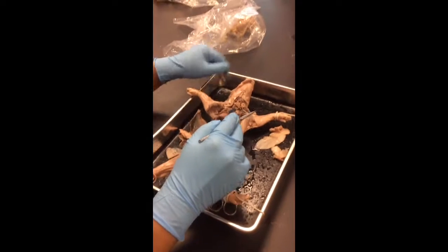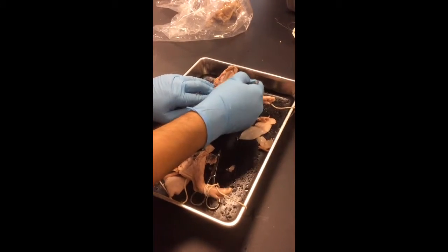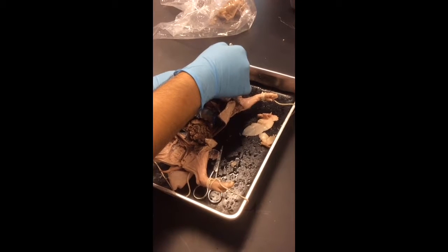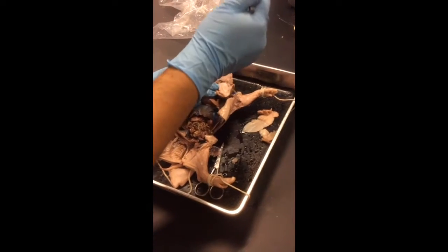The palate, okay, the palate is the top of the roof of the mouth, right? The soft is in the back, hard palate in the front. How would you even be able to see the soft, technically? You can't. If we pinned it, you could technically just write palate and be fine.